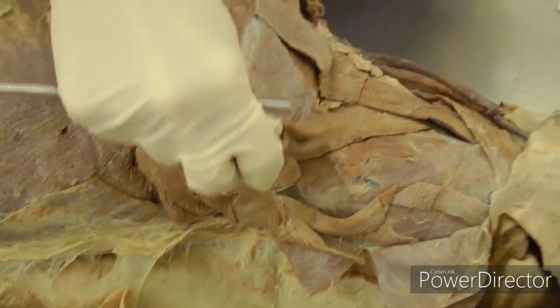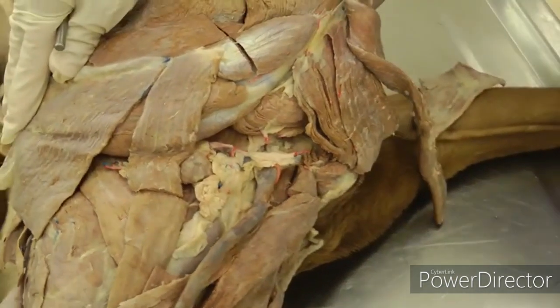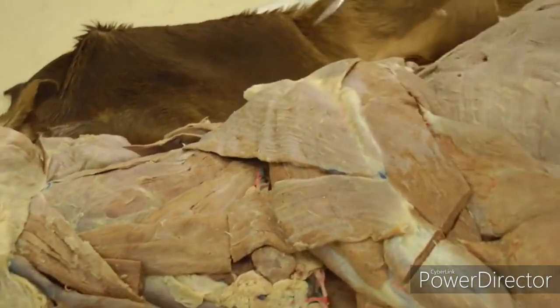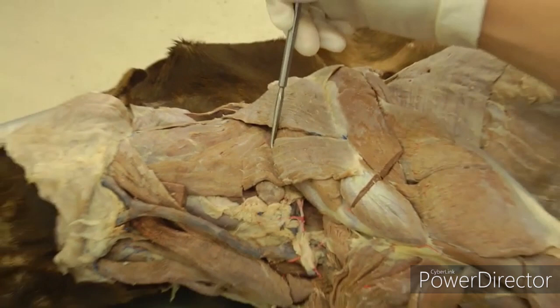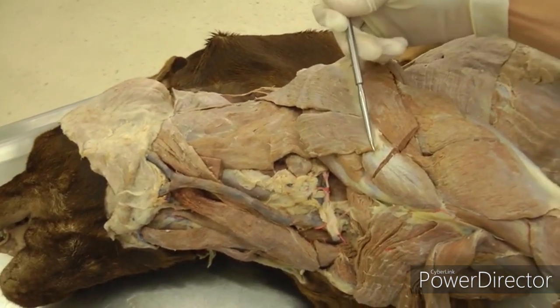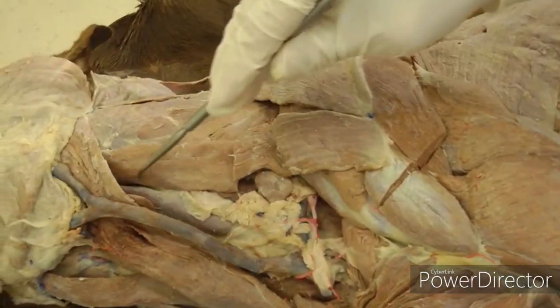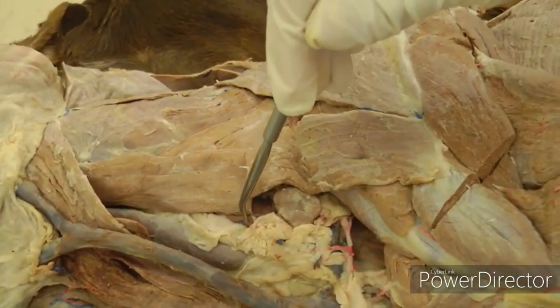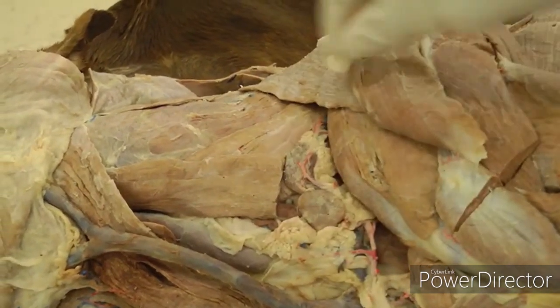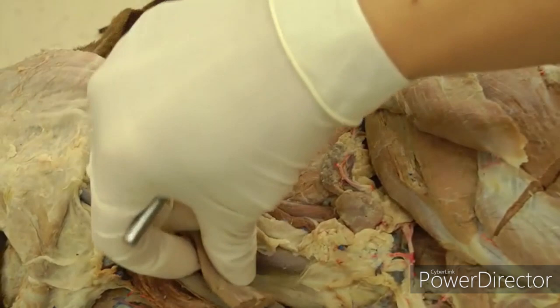Then we'll come back to this side and look at omotransversarius — the muscle we saw going over the lymph node. 'Omo' meaning shoulder, so we start at the shoulder and go up towards the head. You're going to cut that right in the middle, reflect that stump here, leave a stump here to identify later, and just reflect those pieces.